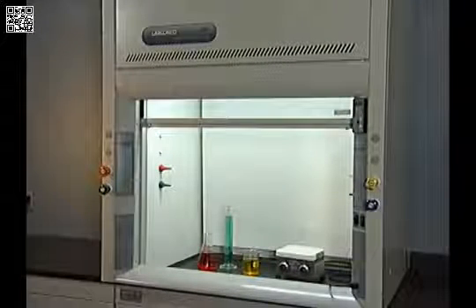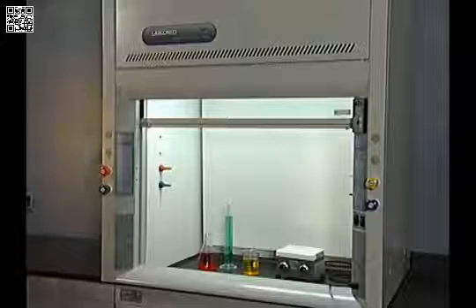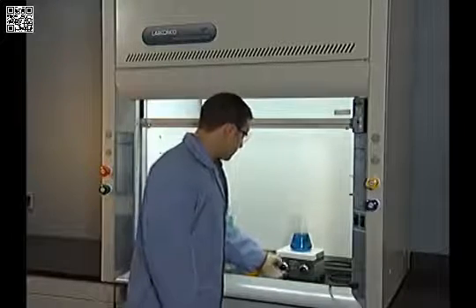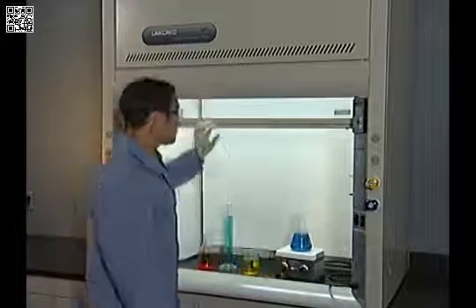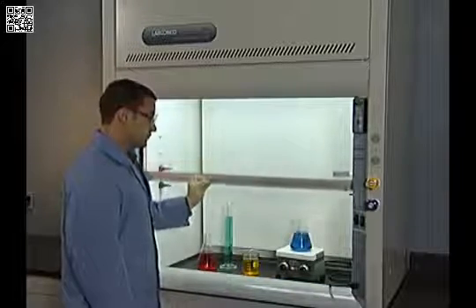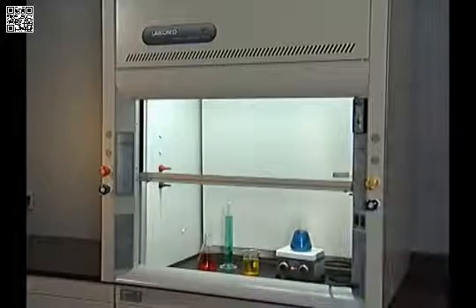Lowering the sash lessens the effect of traffic and other external airflow disturbances. To get the maximum performance from this important piece of laboratory safety equipment, it is important to understand the design and proper operation of your laboratory hood. By knowing how it functions most efficiently, you can ensure that your lab's safety ventilation system is effectively protecting you and your important work.